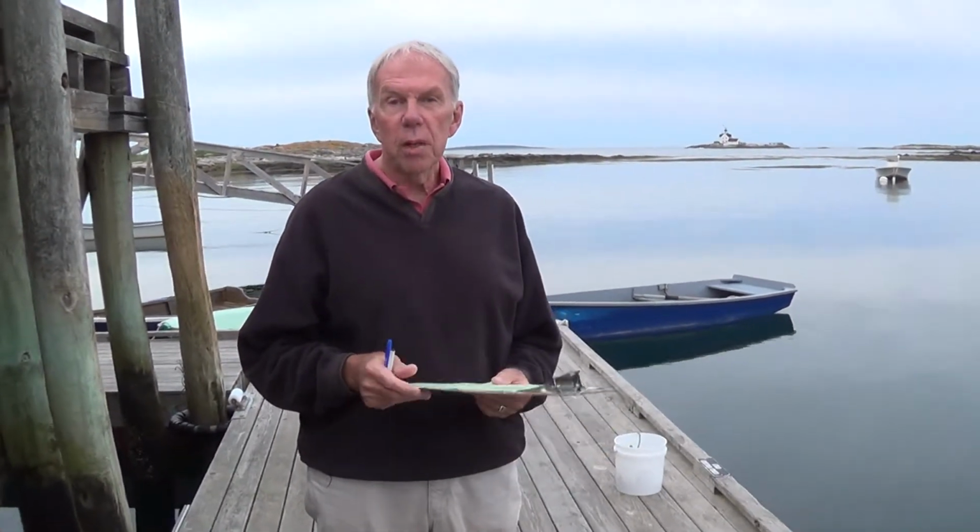All right. My name is Ed Green, and the fellow behind the camera is Robert Jordan. And what we're going to do today is go over the procedures for sampling water for the Boothbay Region Land Trust.